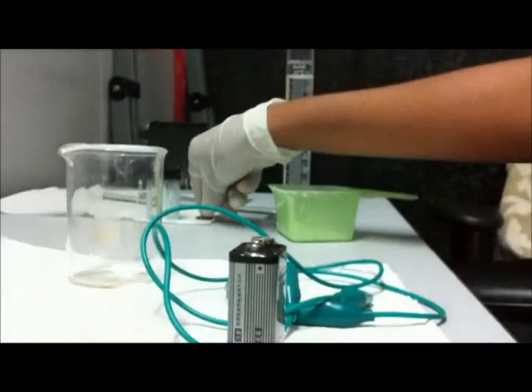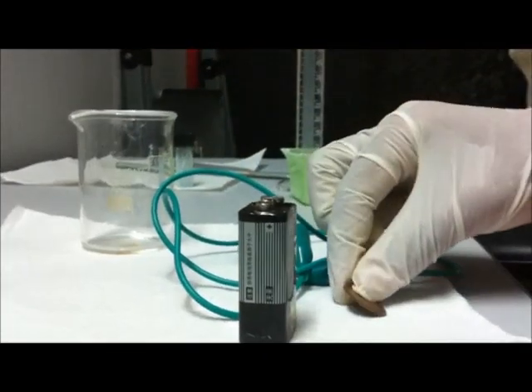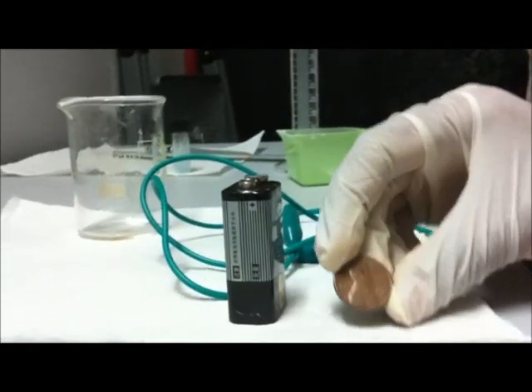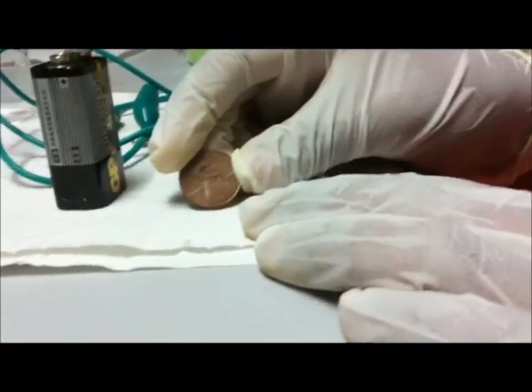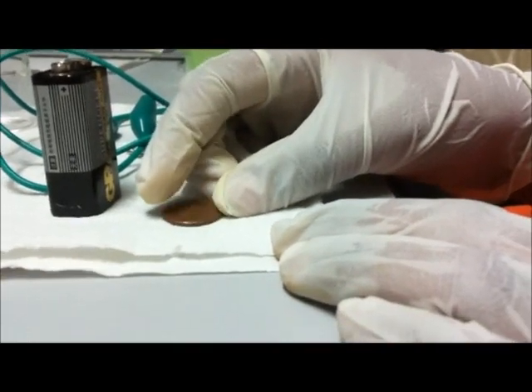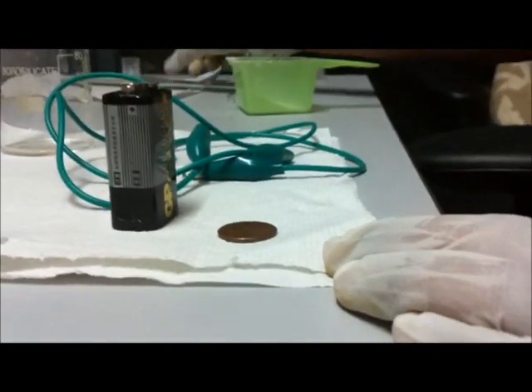Next you'll need a battery and connecting wires, a copper coin. Mine is made from 1976. You can also use coins which are made from 1982 or earlier. Mine is a US penny. You can also use copper wire if you don't have US pennies.